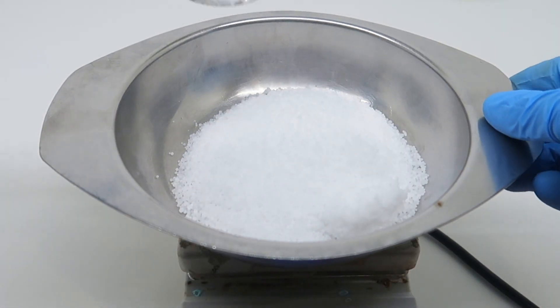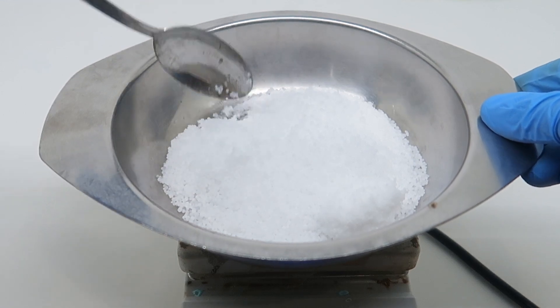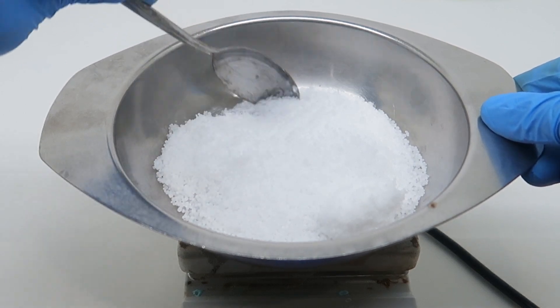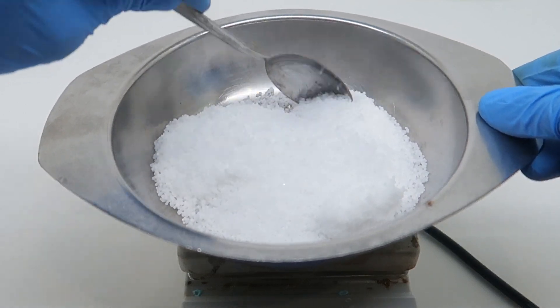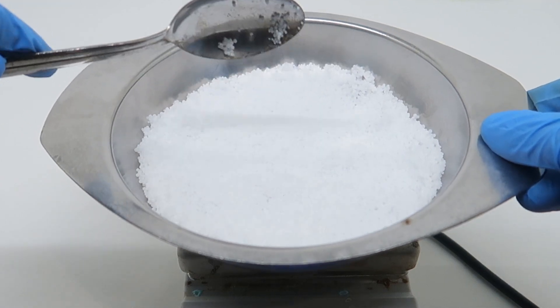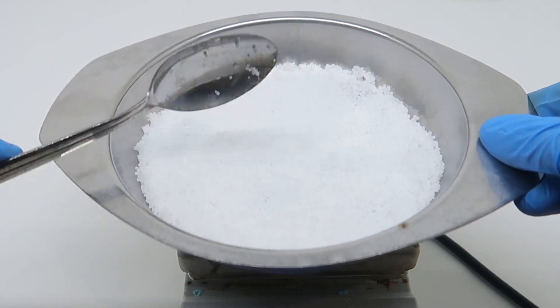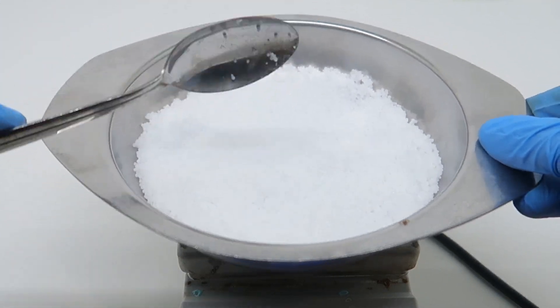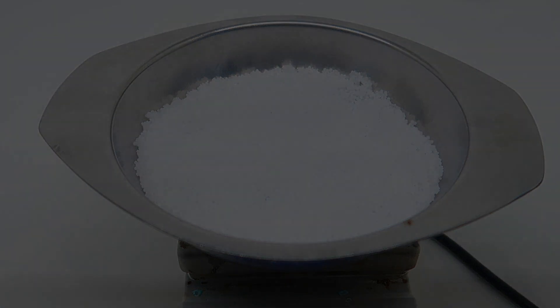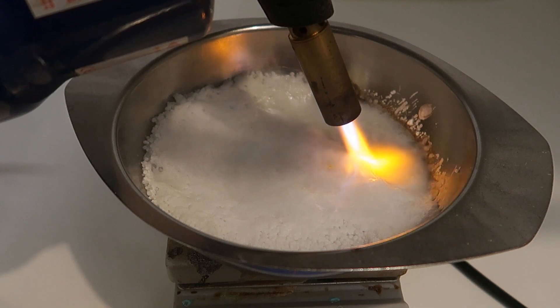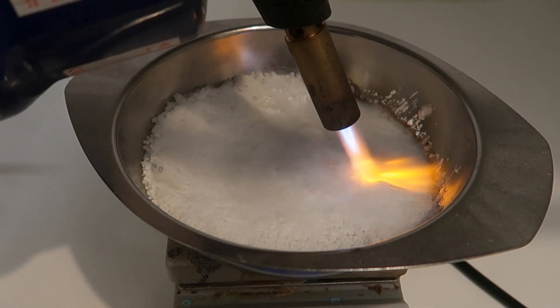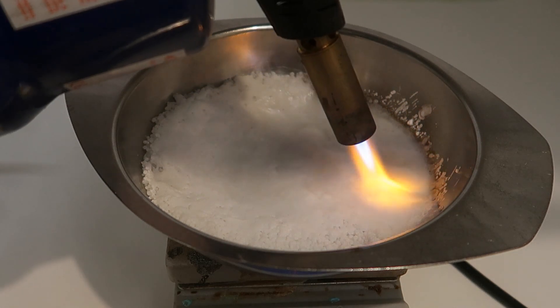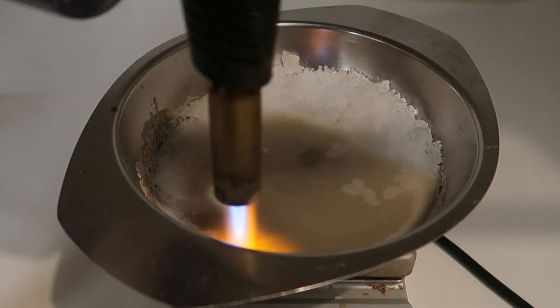In order to melt the sodium hydroxide, I decided to put everything on my hot plate and crank it up to max. However, after a long while, I had to come to the conclusion that it would never work, and so I decided to use something with a bit more persuasion. After a while, it eventually started to melt, which is good.